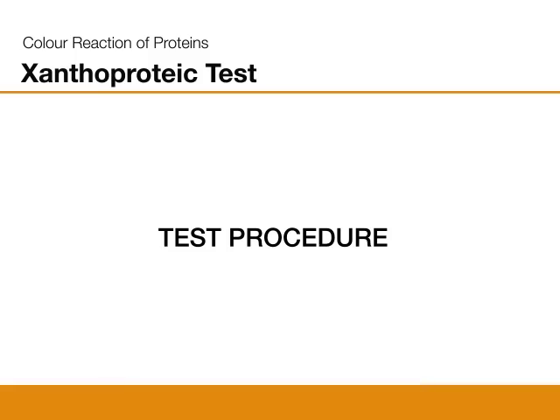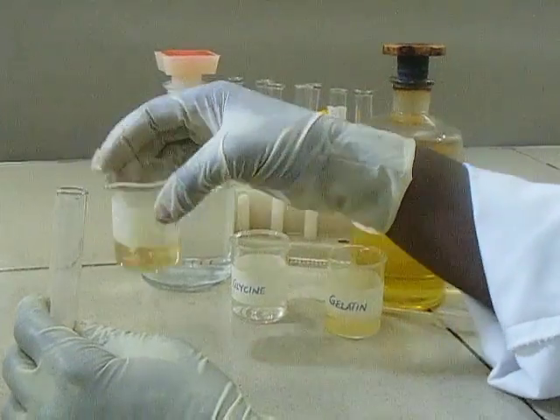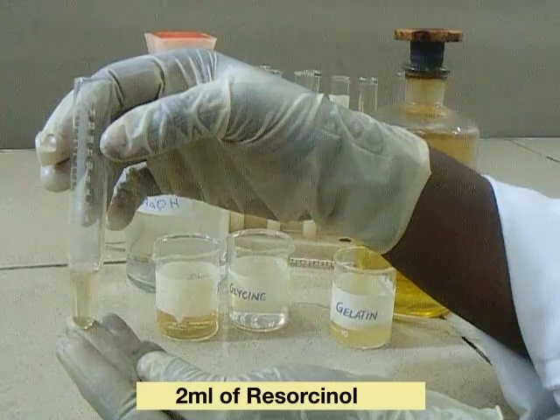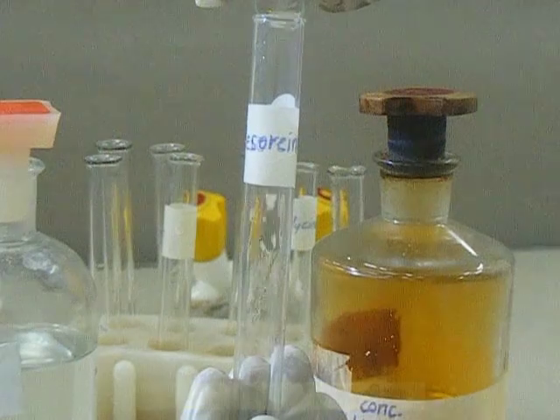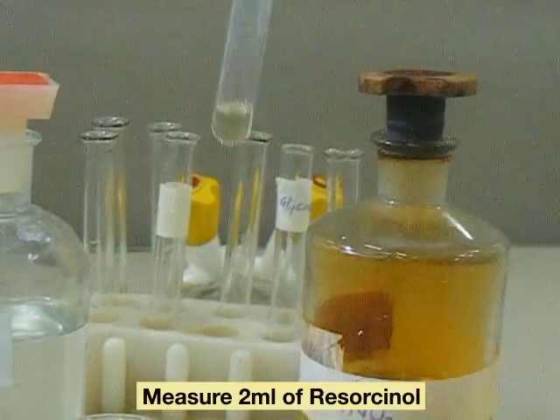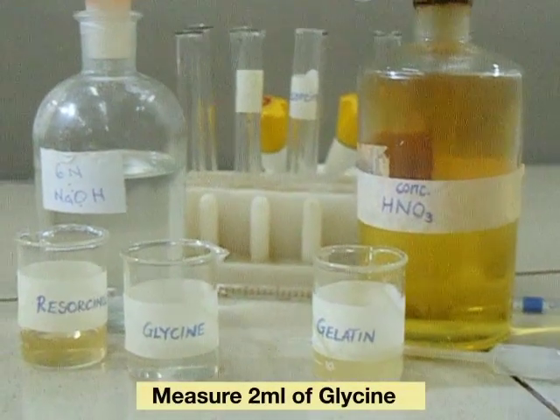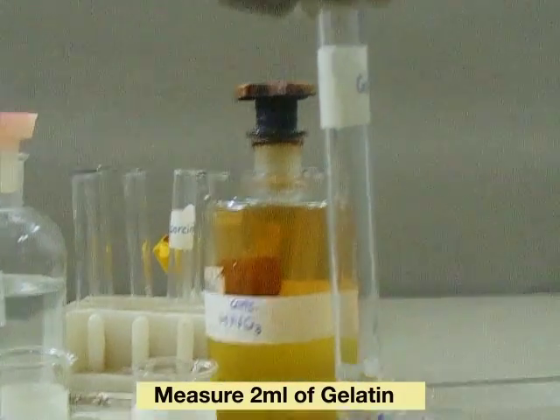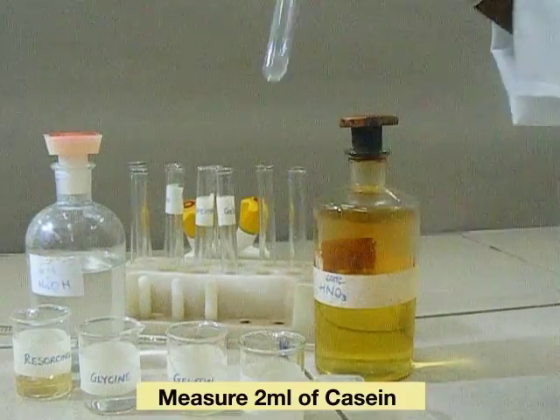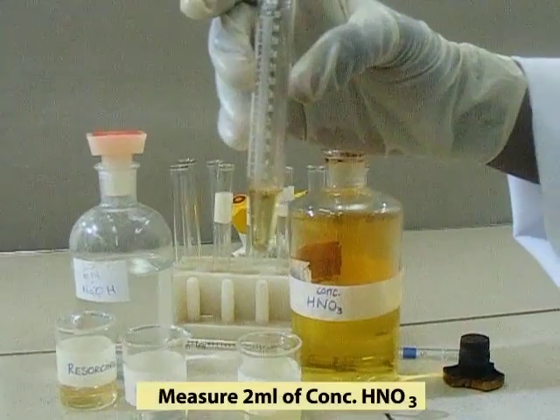Test procedure: Measure two mils of each test solution into labeled test tubes. Add two mils of concentrated nitric acid.